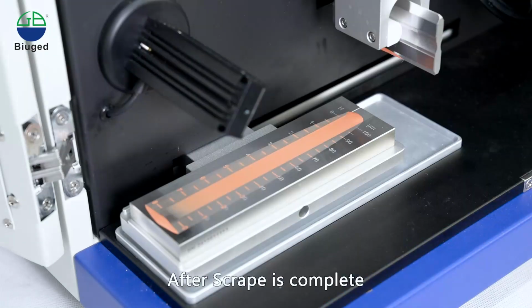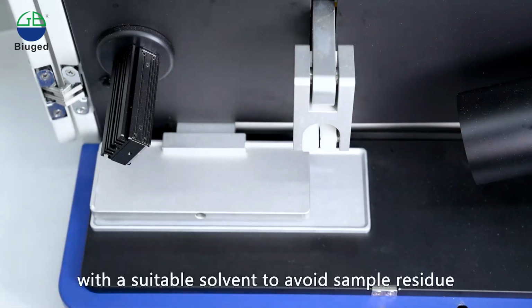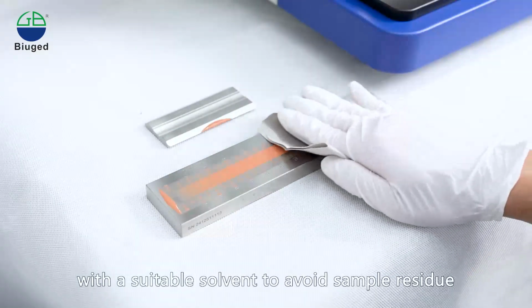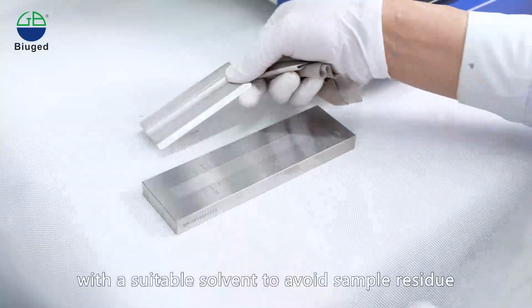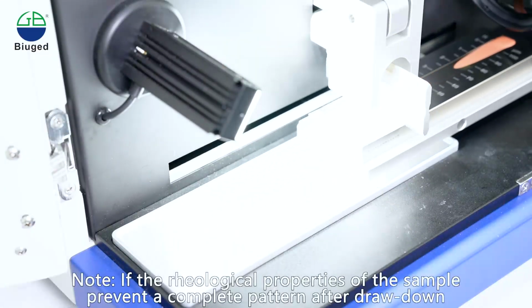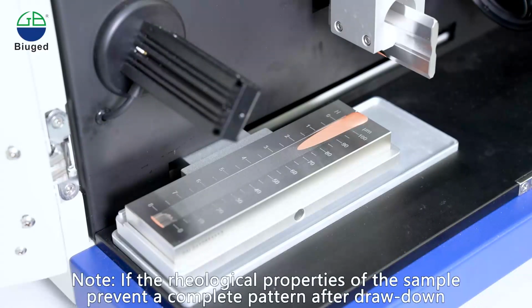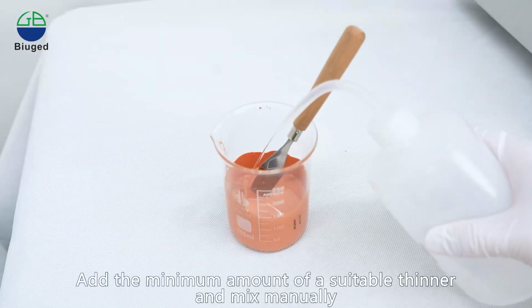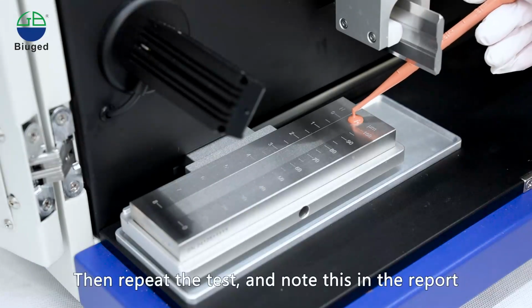After scrape is complete, immediately remove the fineness gauge and scraper and clean them carefully with a suitable solvent to avoid sample residue. Note: if the rheological properties of the sample prevent a complete pattern after drawdown, add the minimum amount of a suitable thinner and mix manually. Then repeat the test, and note this in the report.